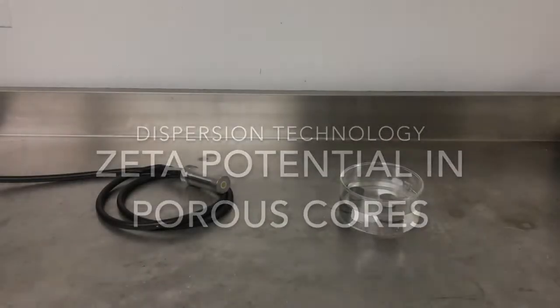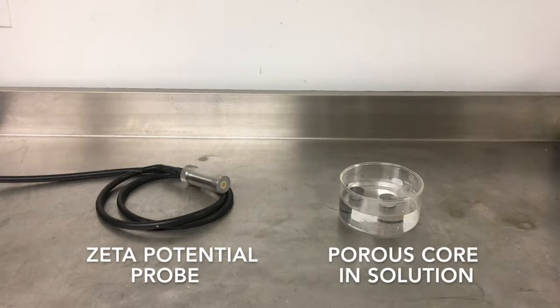In this video, we will demonstrate how to measure the zeta potential inside of a porous core using a zeta potential probe manufactured by Dispersion Technology.